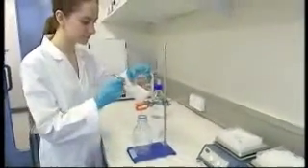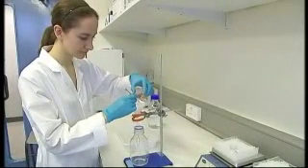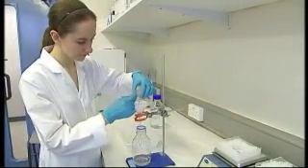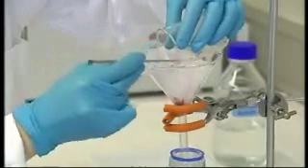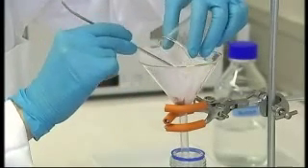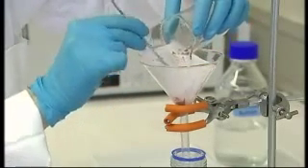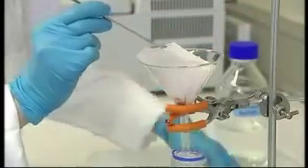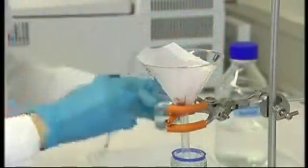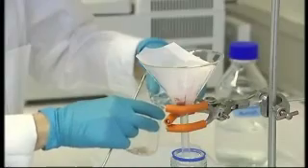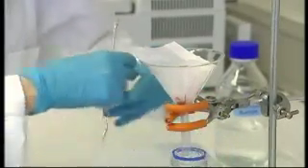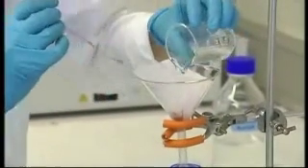Then, filter the suspension through a nylon filter. Wash the minced tissue on the filter 3 times with the washing buffer and discard the filtrate.